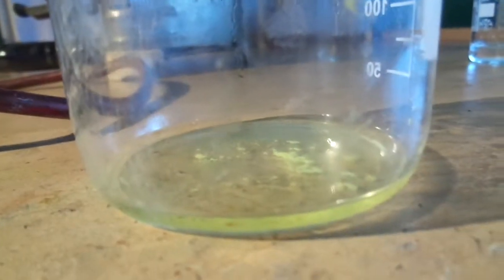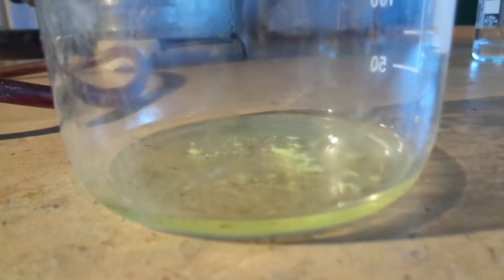The iodoform is actually soluble in acetone. You can see it dissolved, that's cool. But it actually didn't crystallize when I heated it. Maybe it was just too wet, I don't know.